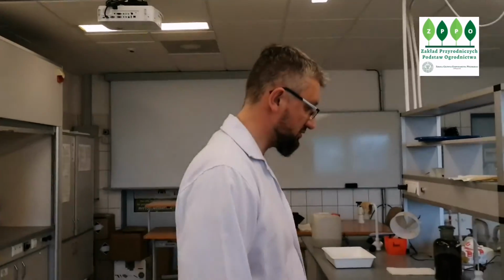Today we will just briefly show you how we will do the measurements, what we will count, what we will measure, and you will get data. You will have to do very simple calculations, you will have to do averages, and also you will get some formulas to calculate tolerance index. Everything will be explained during the classes, and also in the protocol you will have. And we will ask you a question about interpretation of the results. So you will have to give us some of your ideas, how you see the results and why the results are as they are. So I will just show you here.